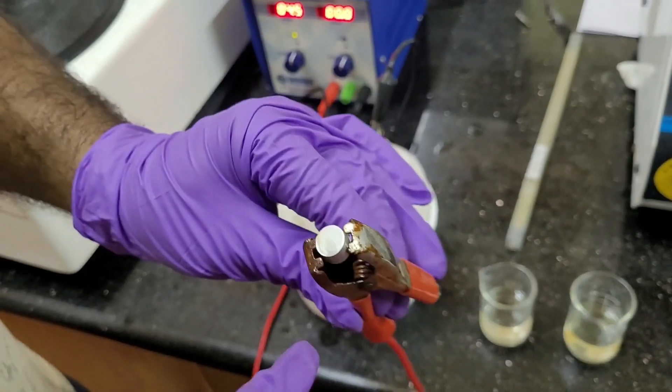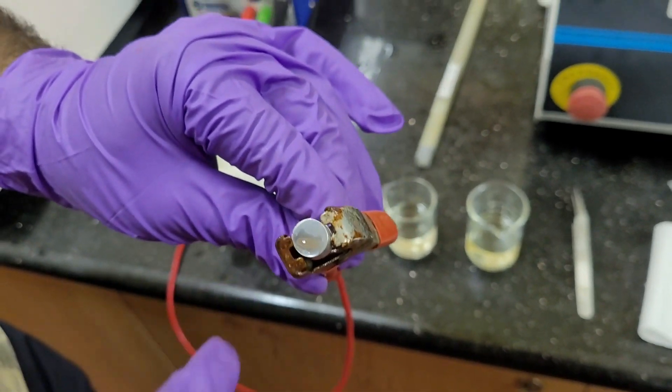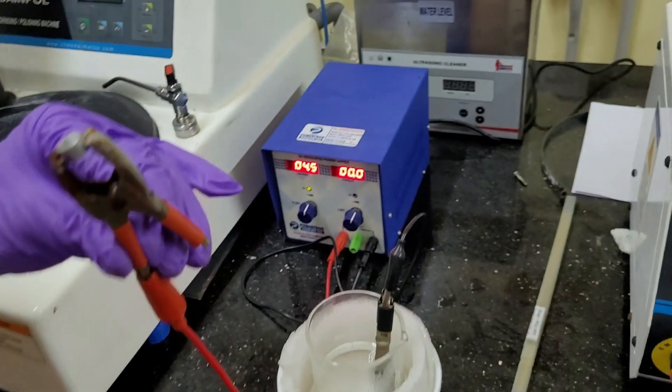So, we can see here, very nice kind of, if you can see, able to see, very nice kind of electropolishing is done. So, this is our optimized parameters. Thank you very much.